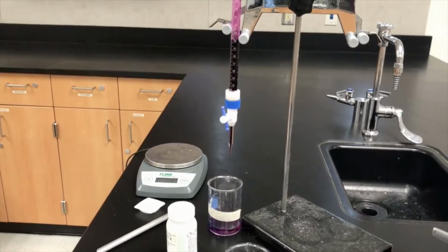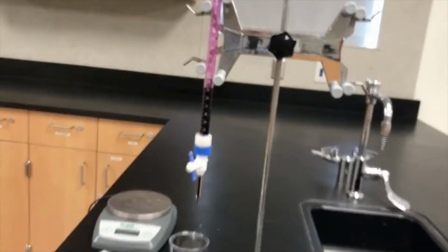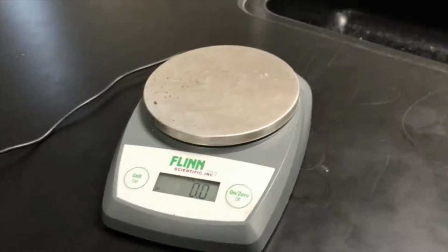Now keep in mind, whenever I'm doing this, I'm using a beaker because that's my universal trash can in chemistry. While that's going, I'm going to do my next step for the lab. I'm going to skip number 7, and in 8 it says obtain a mass between 0.4 and 0.5 grams of ferrous ammonium sulfate in a clean weighing dish using a milligram balance. Record the precise mass in an appropriate data table.